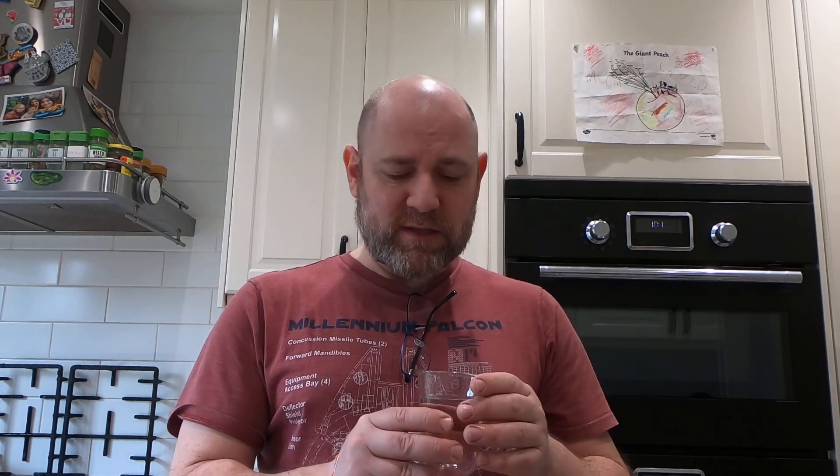Hi guys, welcome to Let's Get to the Marks. I've got some water here, or at least I think it's water. What's the test for water? This is something you need to know for all the exam boards at GCSE and at IGCSE. So let's look at the test for water.